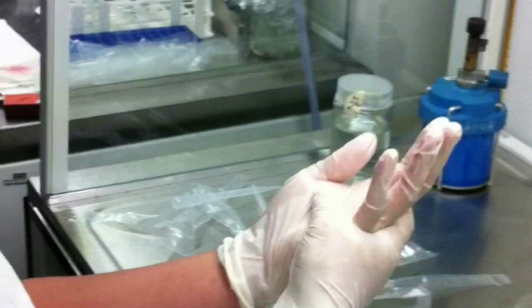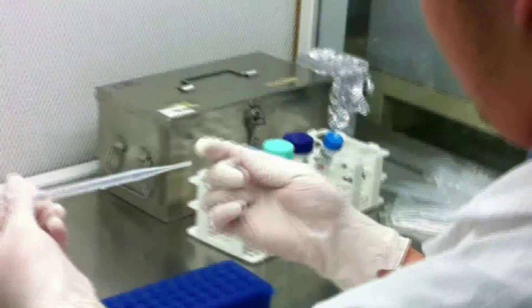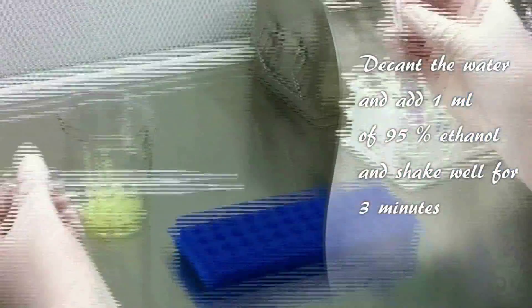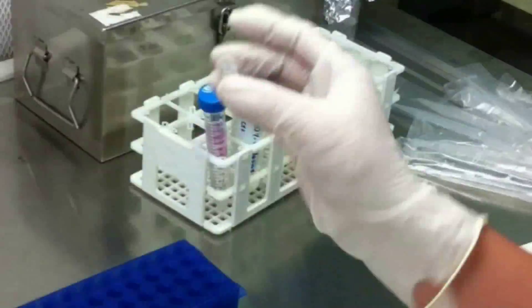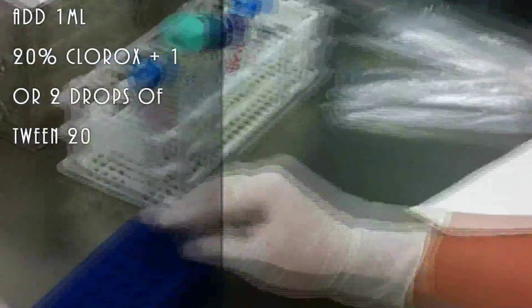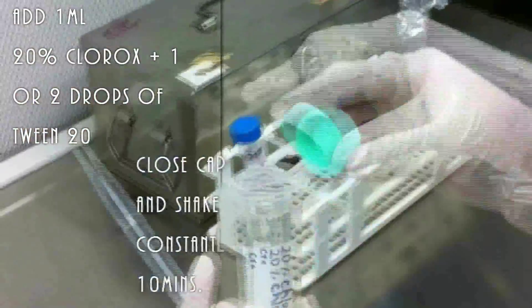Surface sterilization. First, decant the water and add 95% ethanol and soak for 3 minutes. During the soaking process, the epi-tubes are constantly shaken to maximize the process. Remember to keep the aseptic technique at all times. Secondly, decant the ethanol and add 20% Clorox bleach with a few drops of Tween 20, and soak for 10 minutes exactly with constant shaking.